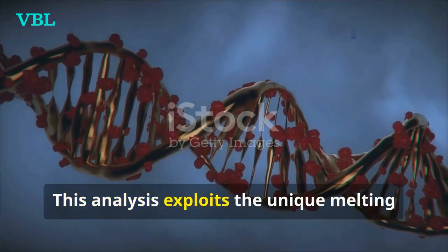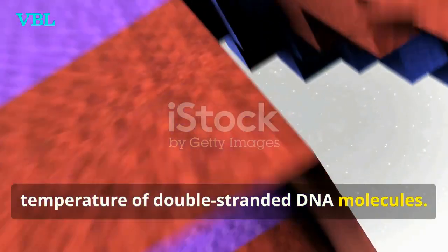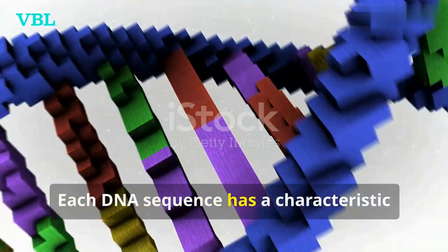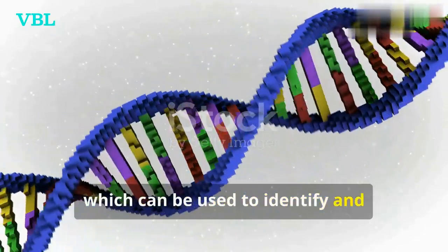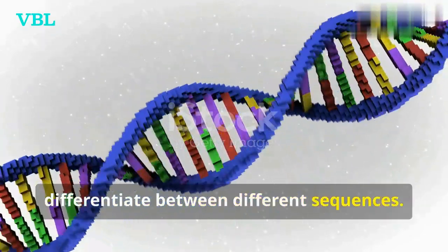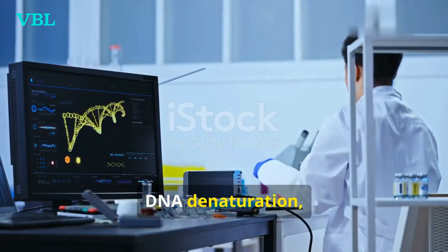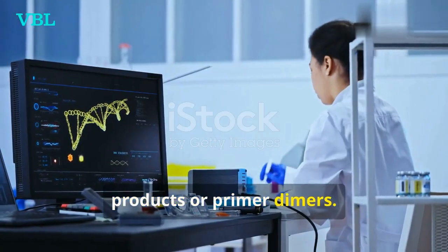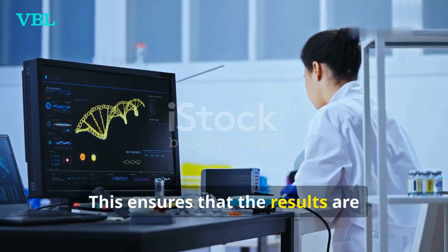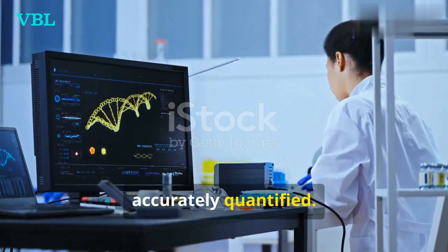This analysis exploits the unique melting temperature of double-stranded DNA molecules. Each DNA sequence has a characteristic melting temperature, which can be used to identify and differentiate between different sequences. By monitoring fluorescence changes during DNA denaturation, researchers can identify non-specific products or primer dimers. This ensures that the results are reliable and that the target sequence is accurately quantified.